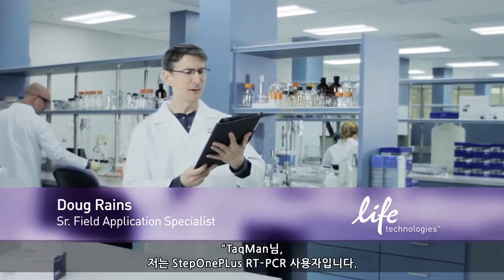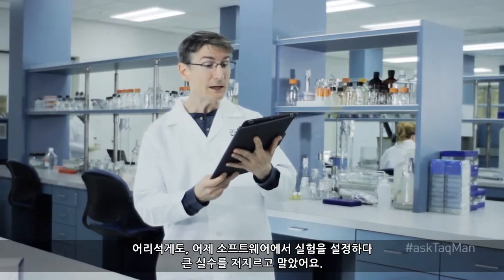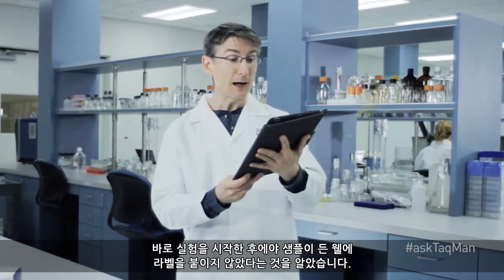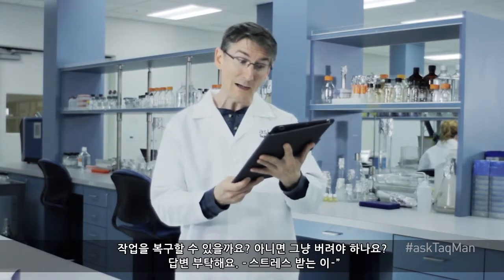Dear TaqMan, I'm a devoted StepOnePlus Real-Time PCR system user. Yesterday, I made a huge mistake while setting up my experiment in the software. Namely, after I started my experiment, I realized I'd forgotten to label a row of wells that contained samples. Can my run be salvaged, or is it trash?